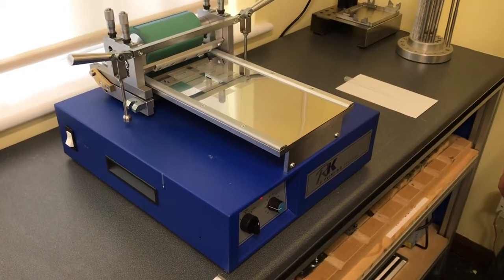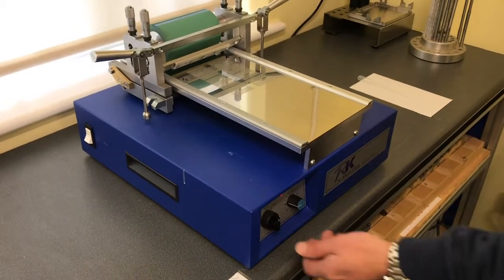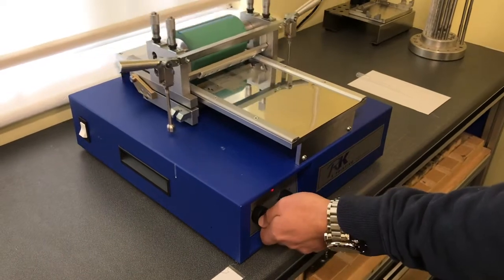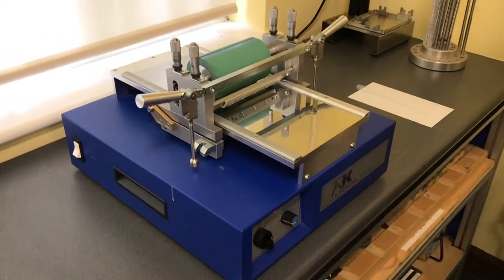KPP setting. Start by moving the head to the central position, clamp your head down.